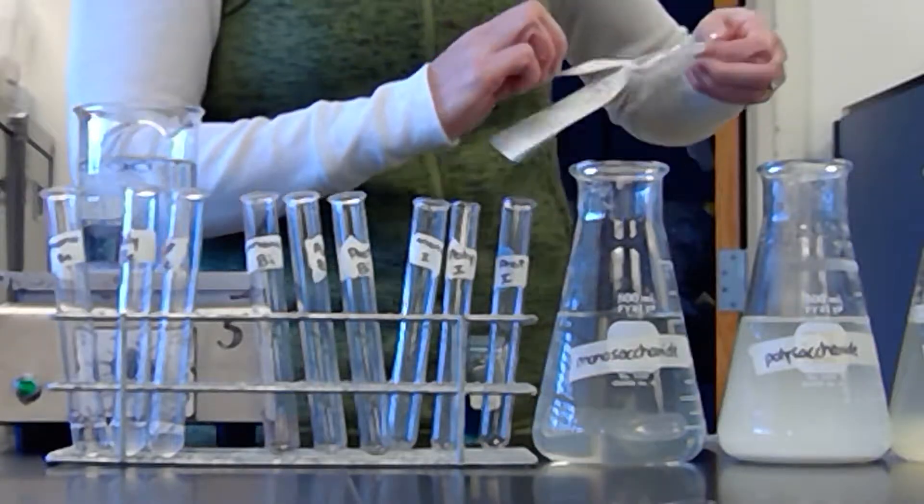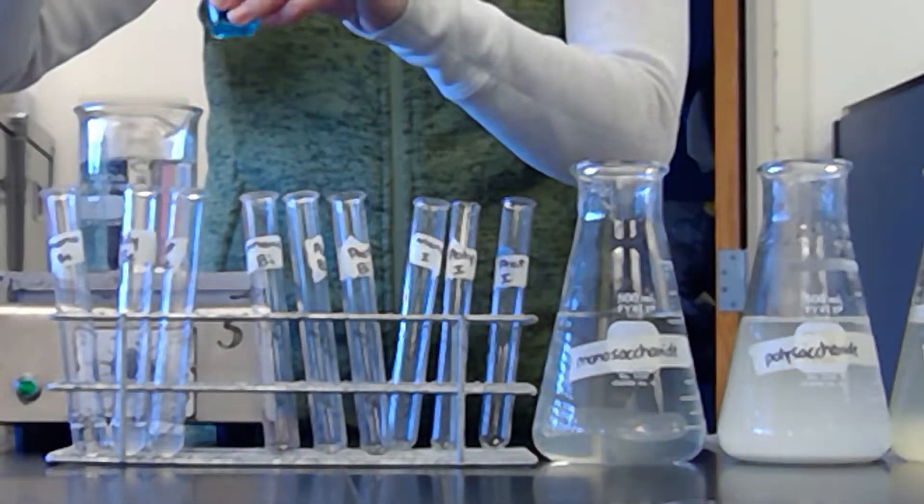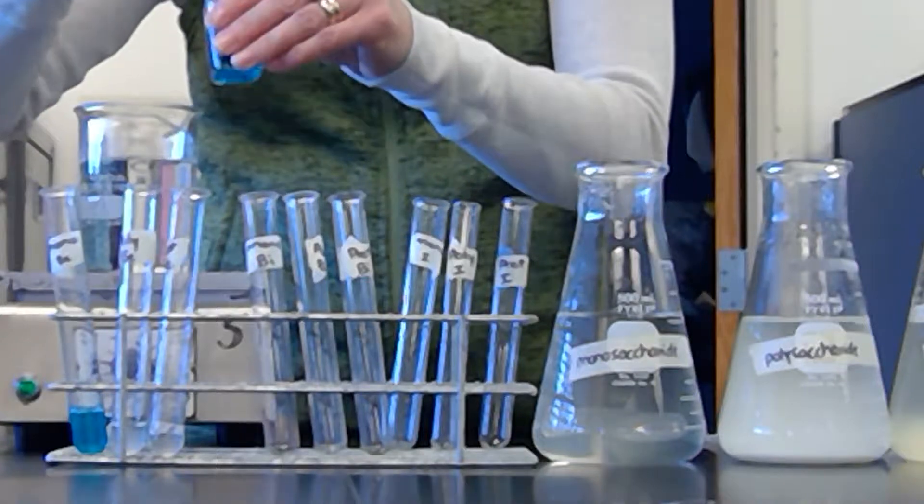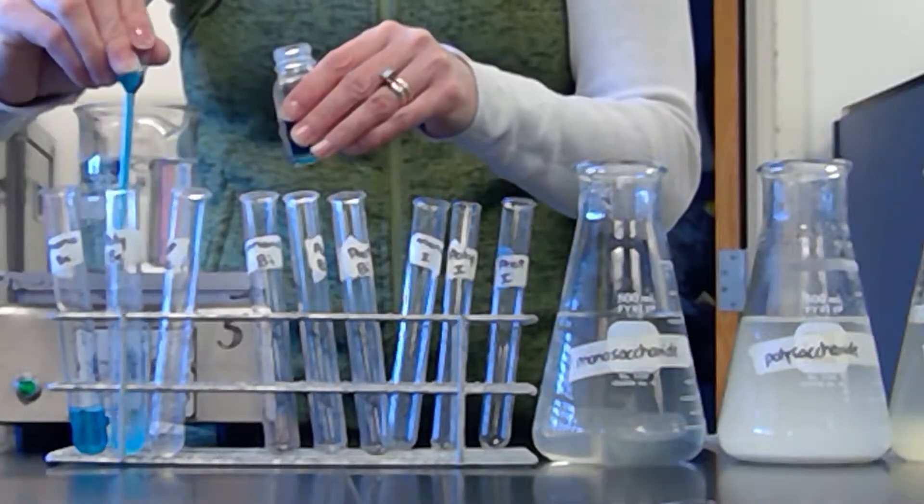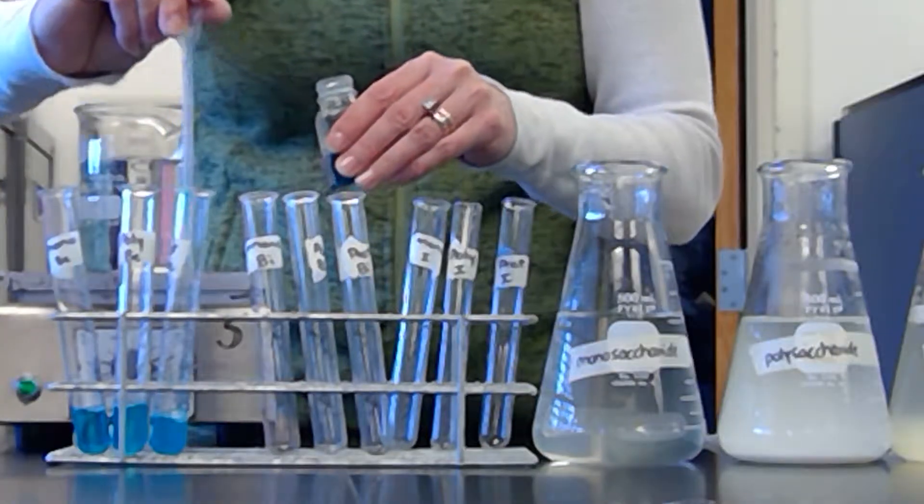And then proteins are proteins like meats and eggs and different stuff like that. So when I do this, I just say give it a big healthy squirt of each, and so you're going to have sort of a one-to-one at this point. I'm using a bigger pipette because the one in the bottle broke, but that's no big deal.